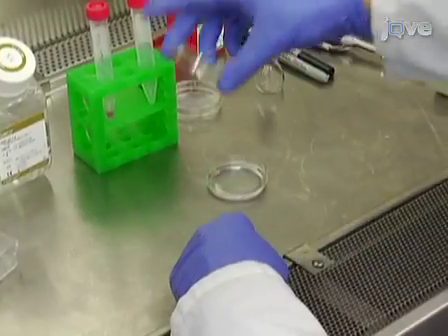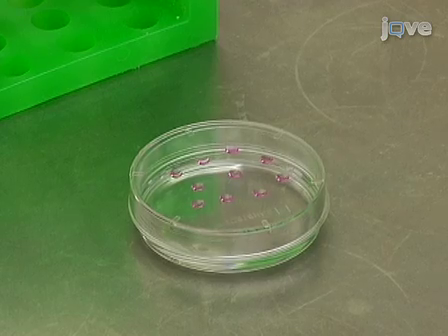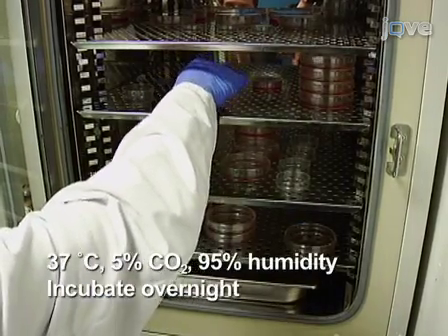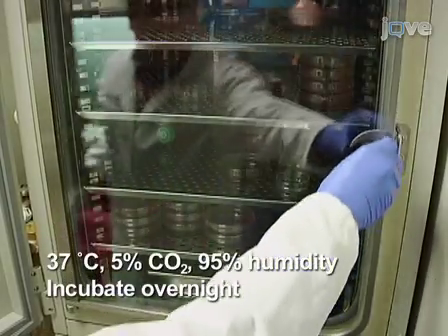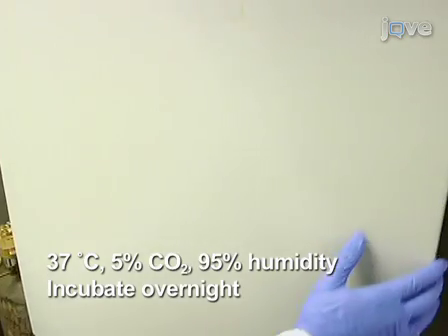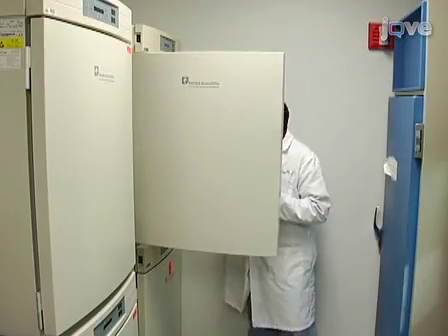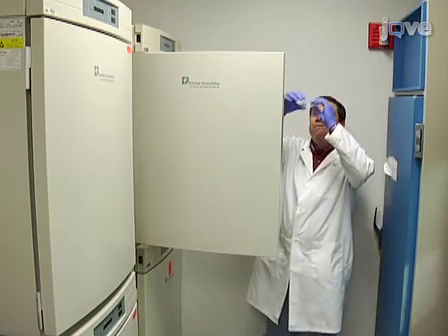Gently replace the lid containing the drop cultures back onto the bottom of the PBS-containing dish. Place the culture plate into a tissue culture incubator set at 37°C, 5% carbon dioxide, and 95% humidity and incubate overnight. Monitor the drops daily and continue the incubation until either cell sheets or aggregates have formed.